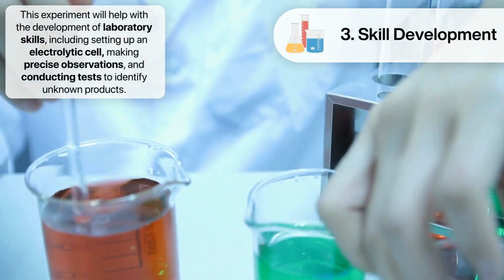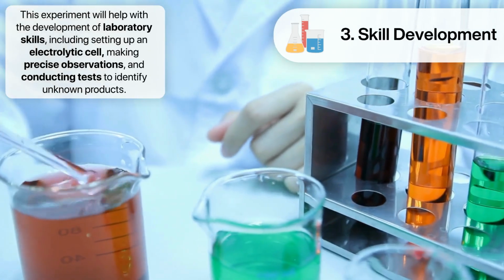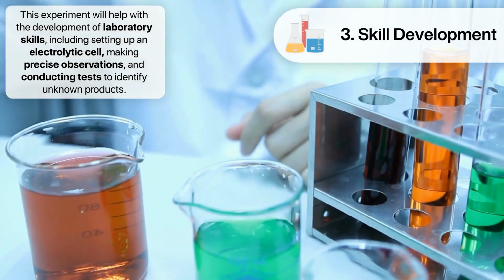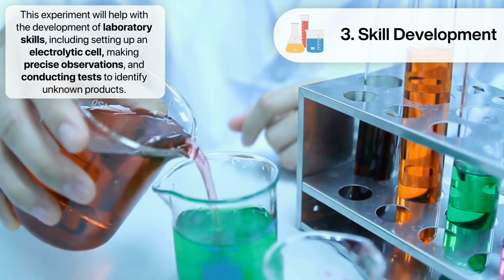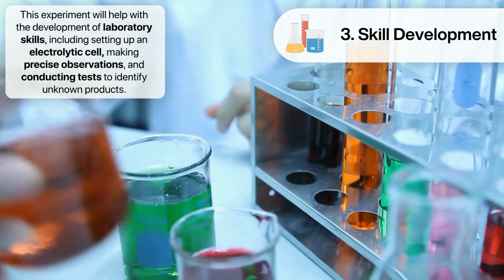Finally, conducting this experiment will help you develop key laboratory skills, such as setting up an electrolytic cell, making precise observations, and conducting tests to identify unknown products. These skills are essential for anyone pursuing a career in chemistry or related sciences.